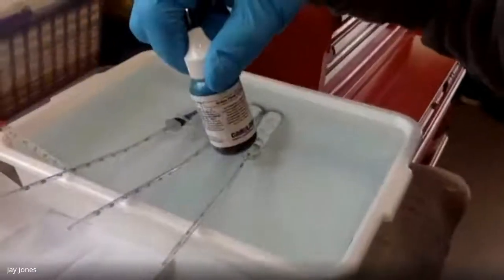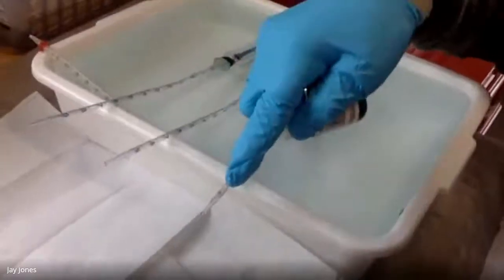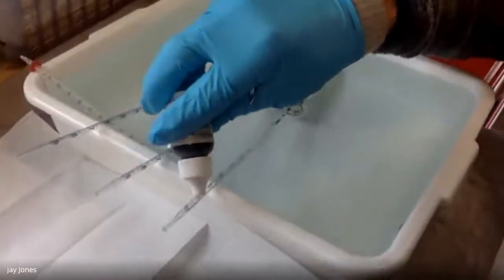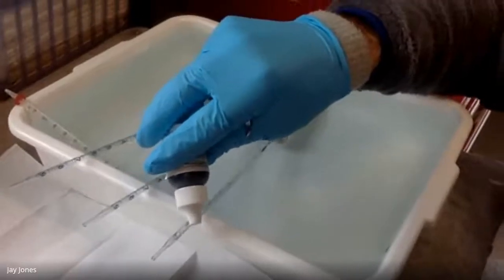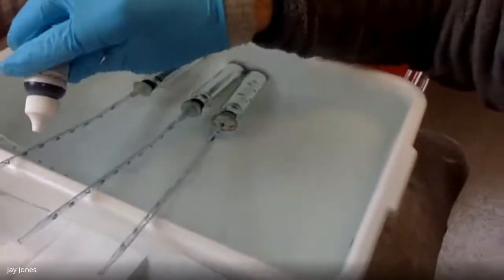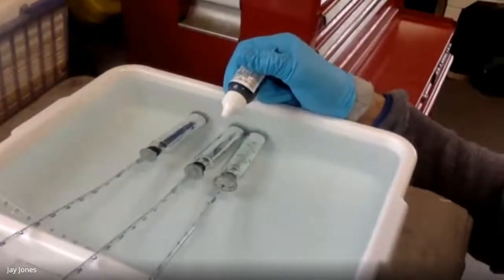Aha! Food coloring. This is the best part of this lab. We're going to put food coloring, I call it a color load, into the pipette. And the color should, if I do this right, move into the pipette over time, because peas consume oxygen and make CO2.